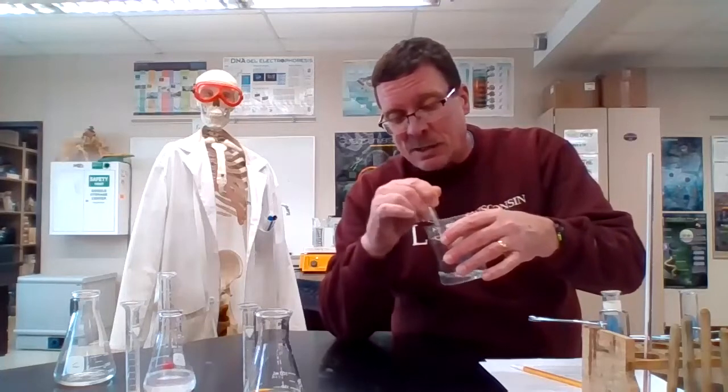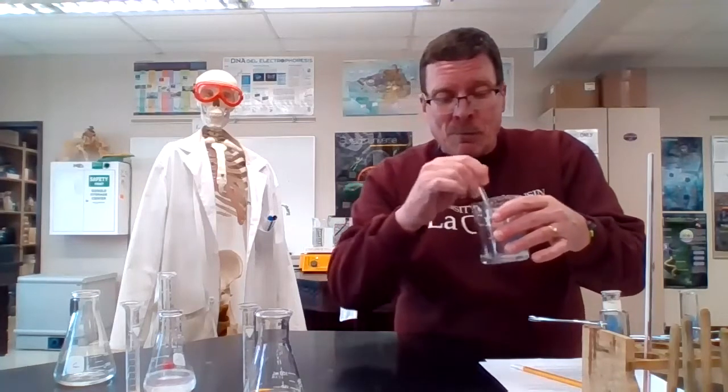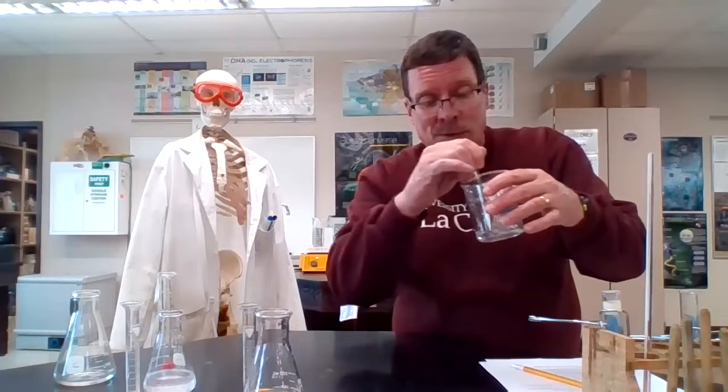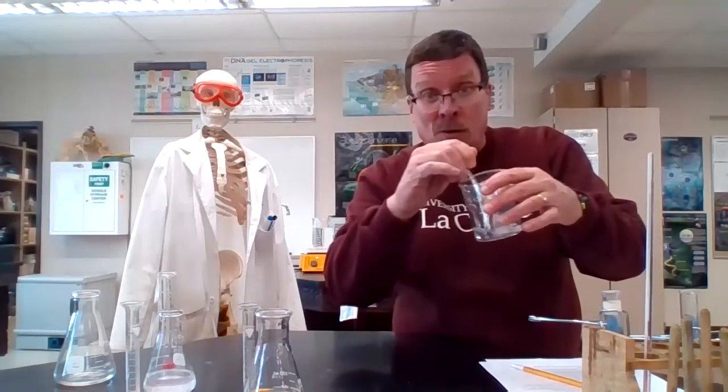Theoretically, as we watch this, room temperature was about 70 seconds, so we hope that this takes longer. We have cooled it down. The energy level of the reactants should be lower, less kinetic energy, which means less chance of colliding. It'll be moving slower. They'll be colliding with less energy. That decreases the chance, as we talked about activation energy, that they will collide with the appropriate energy and orientation for the reaction to occur. And that's what will make the rate go slower. In theory, I'll be happy when I know we're past 70 seconds.